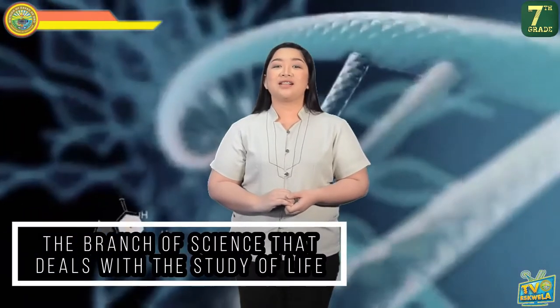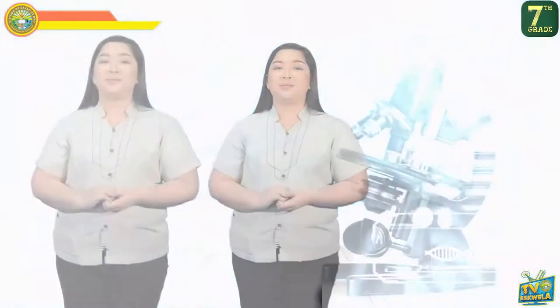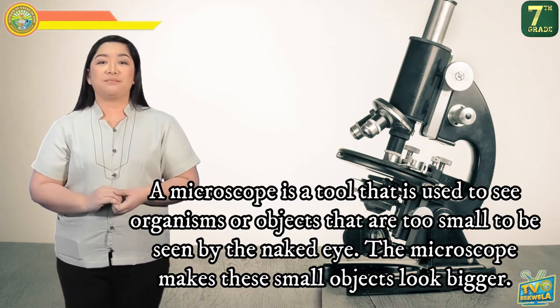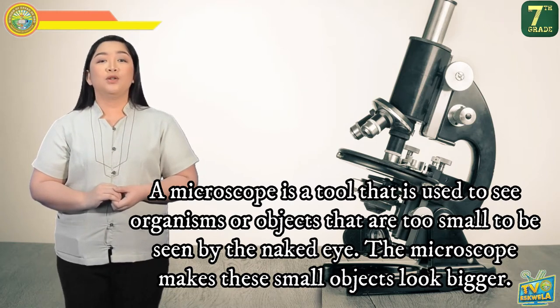The branch of science that deals with the study of life is known as biology. One of the tools used by scientists to study life is called a microscope. With the invention of the microscope, we are able to understand life even better. A microscope is a tool used to see organisms or objects that are too small to be seen by the naked eye.